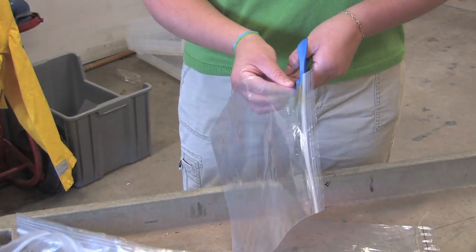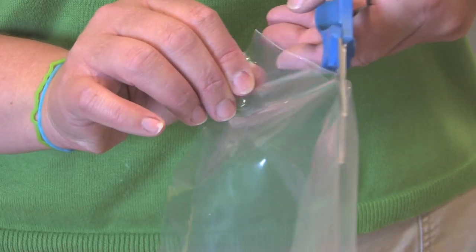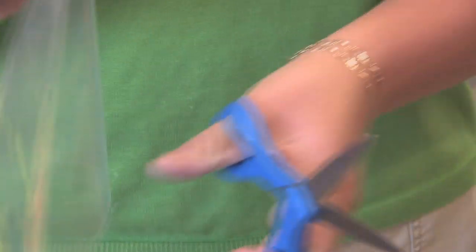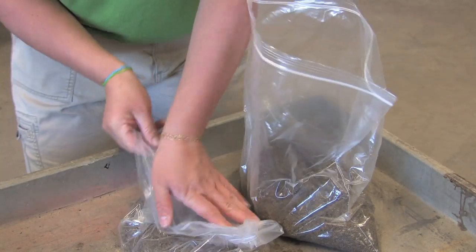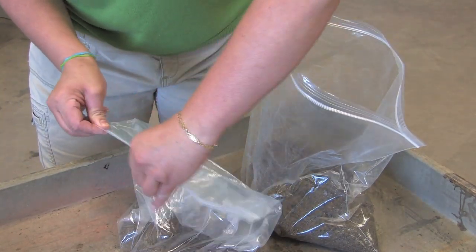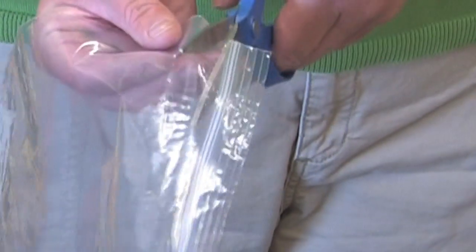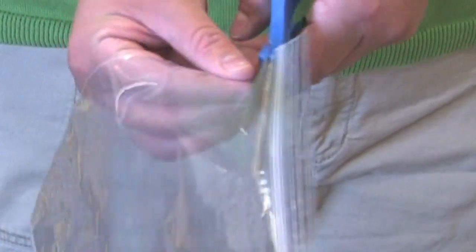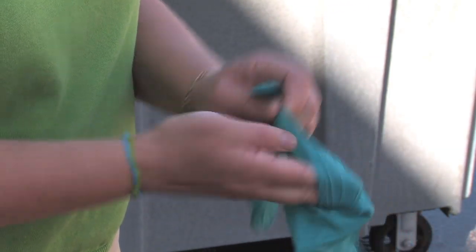Cut the top and sides off one of the two-gallon bags and unfold that bag. Fill the other two-gallon bags about a quarter full of sand, then squeeze all of the air out and zip the bags shut. Cut the top off the quart-sized bag. Now let's go outside to collect the sample.